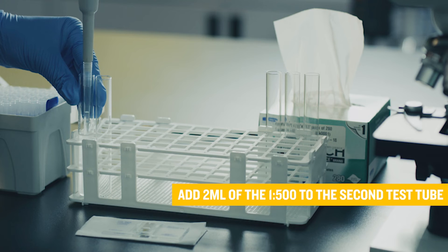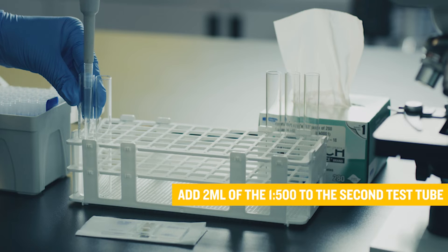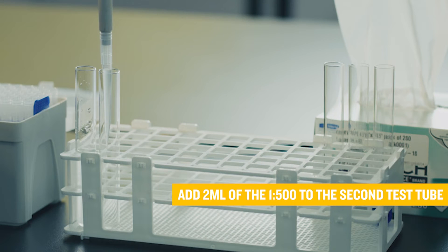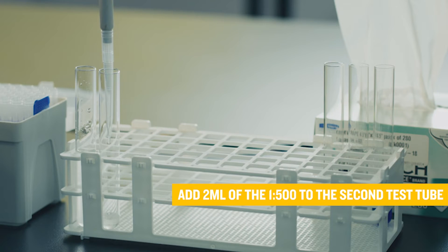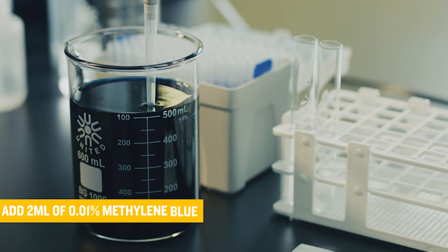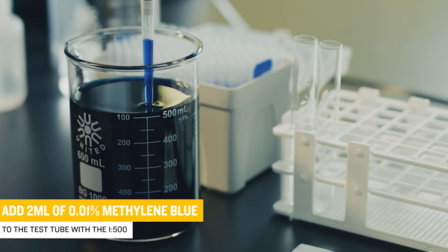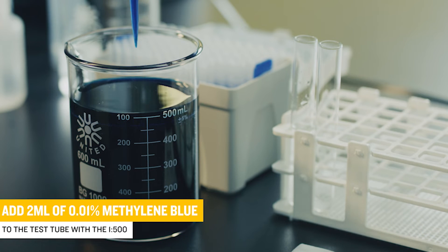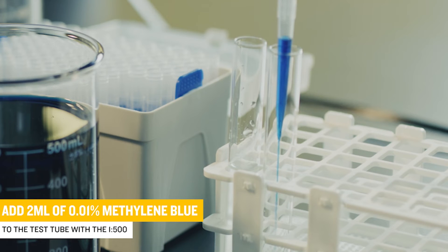Next, add 2 milliliters of the 1 to 500 dilution to a clean test tube. Finally, add 2 milliliters of the methylene blue to the test tube with the 1 to 500 dilution. You have now created a 1 to 1,000 dilution.